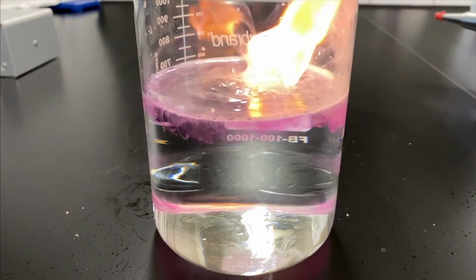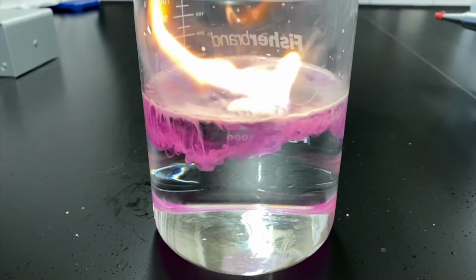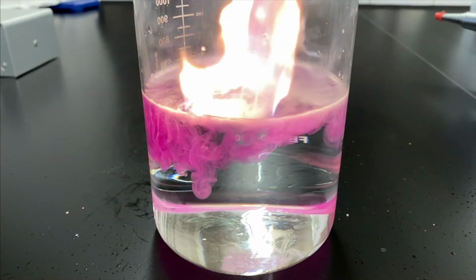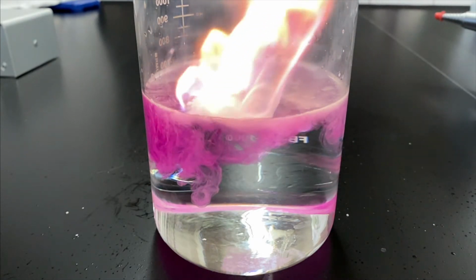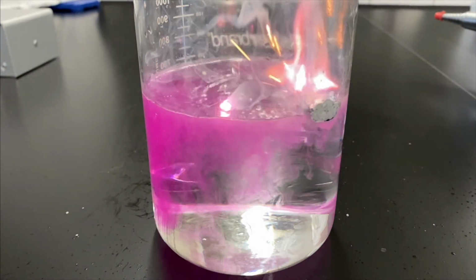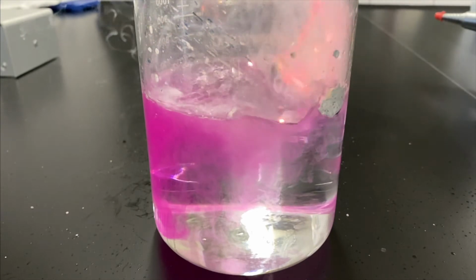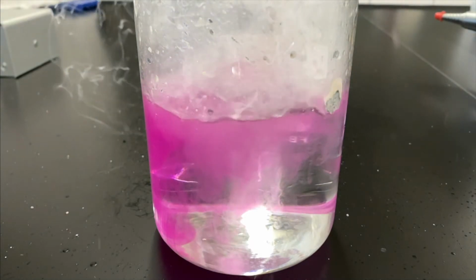And this time, if you see this pink color coming off, if you remember from acid-base titrations, we use this indicator called phenolphthalein, which anytime it's in a basic solution, it turns bright pink. So actually you can see in this slow motion, we have our potassium metal on the water, and you can see the flames coming off from the side that's not even touching the metal. That's where the hydrogen gas is being produced, and that's where the flame is going. And then underneath, and there we have some more cool explosions, we know that we have the hydroxide floating around in solution because of our phenolphthalein. And if you want to just look up cesium in water, you can see this trend even more as you go down the periodic table.